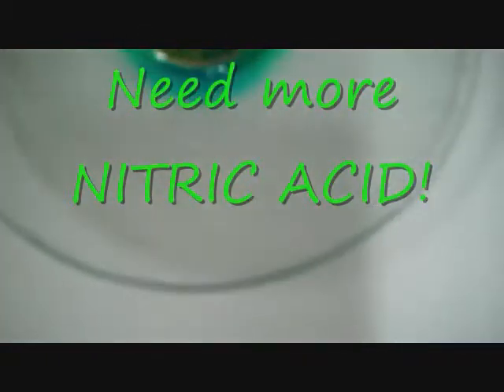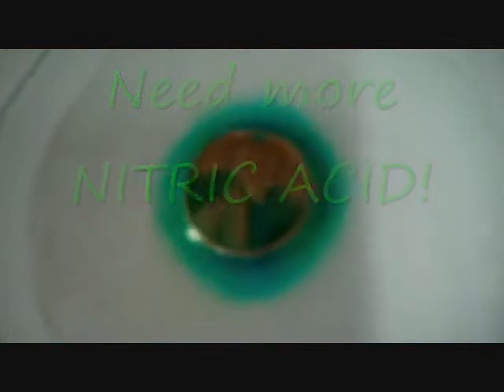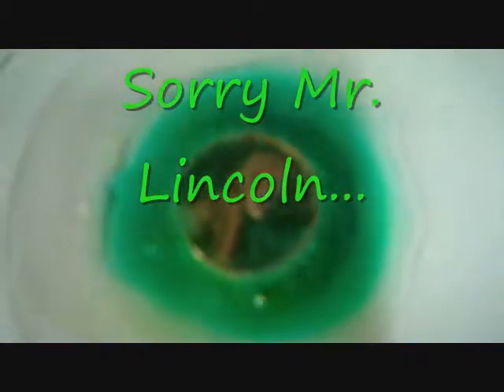I think we need some more nitric acid. Now we're cooking. Poor Abe.